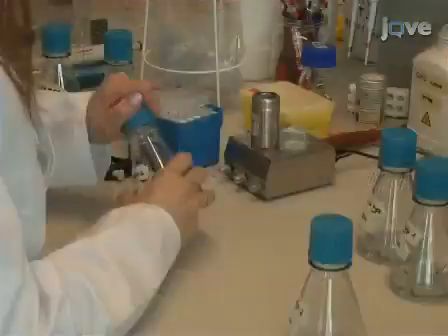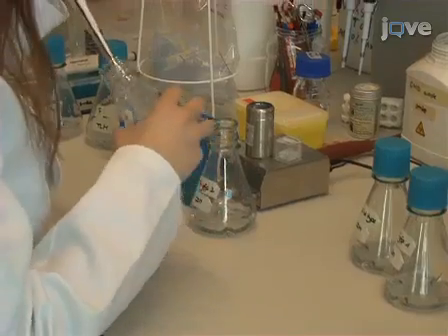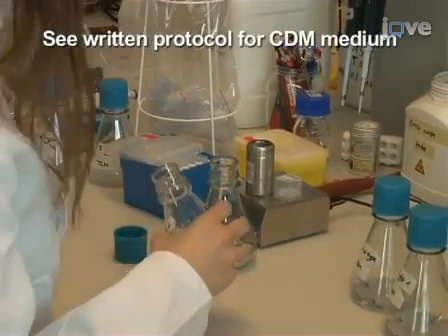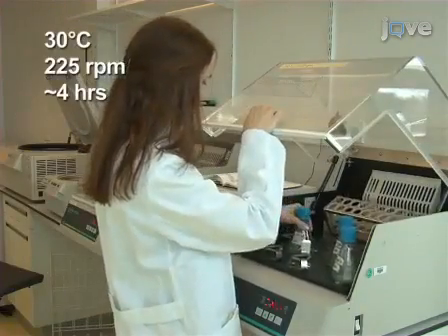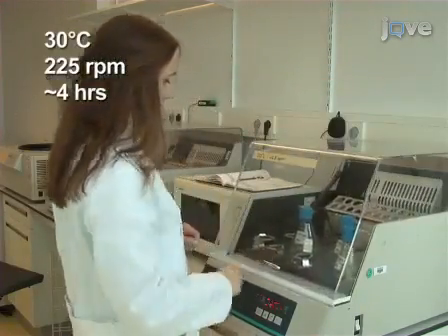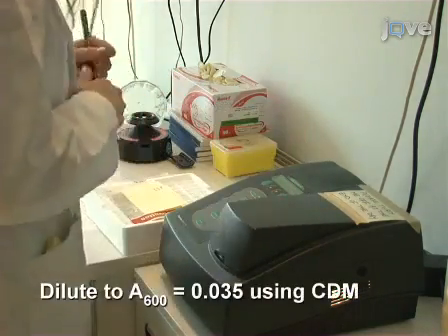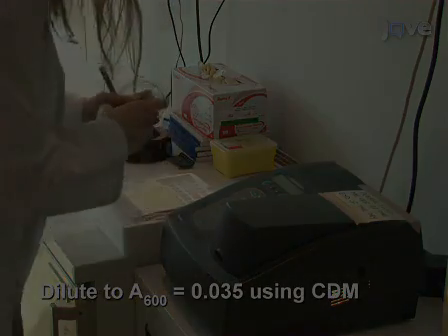The following morning, dilute the cells 1 to 10 in pre-warmed chemically defined medium, or CDM, without antibiotics. Grow the B. subtilis cells to mid-exponential phase, which takes approximately 4 hours. Measure the absorbance of the culture at 600 nanometers and dilute the cells to an approximate A600 of 0.035 using CDM.